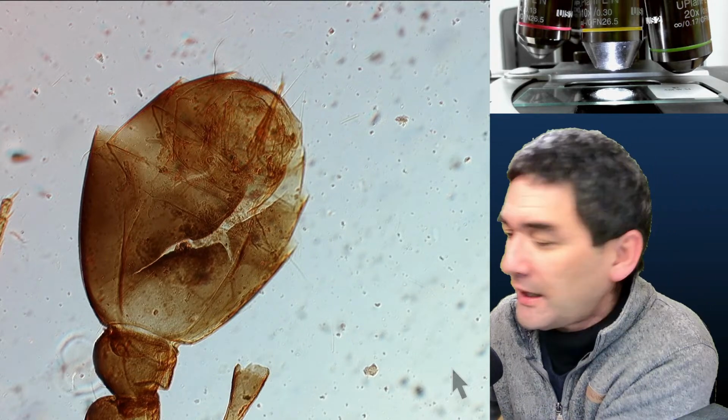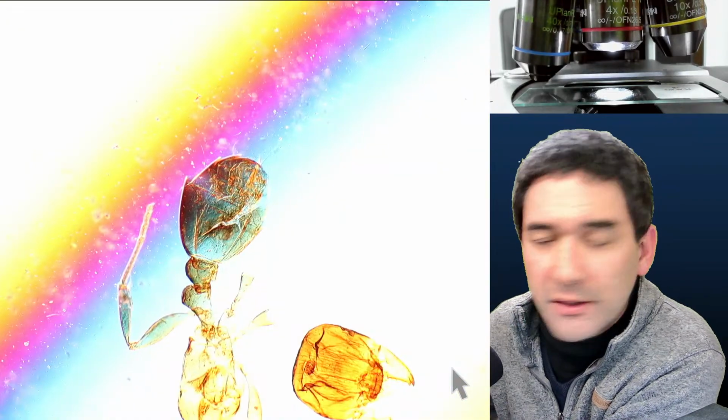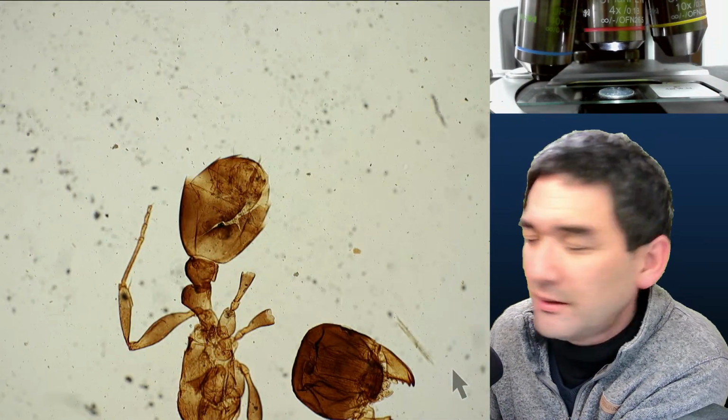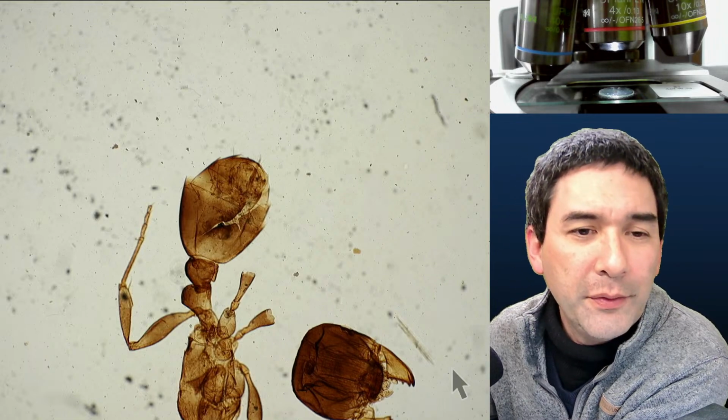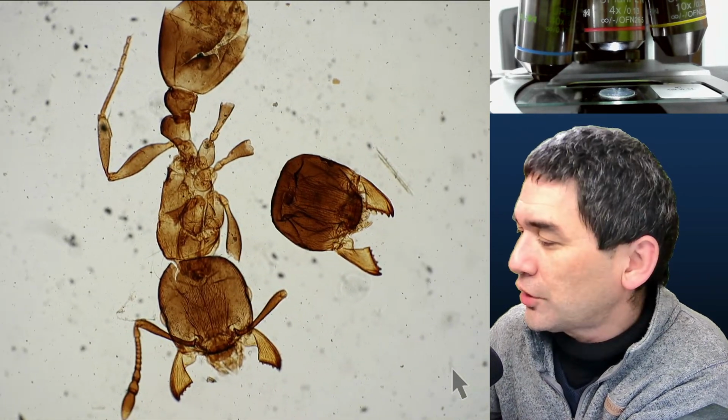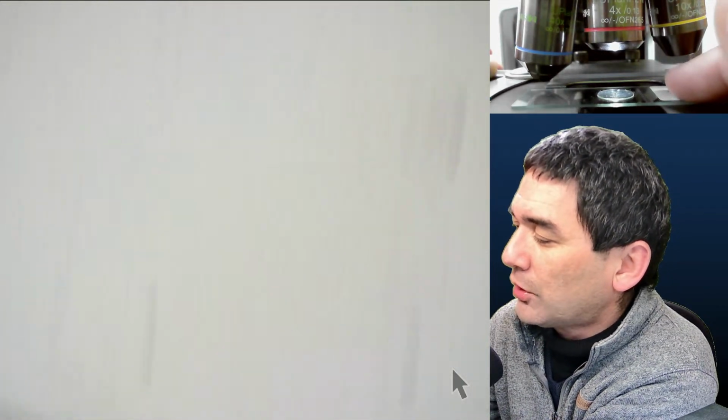And this is actually one that I already showed you some time ago. So you know what, I'm just going to stay with bright field. I'm not going to bother about the polarization filter, because if I just stay with bright field, that's actually the way that you're also going to see it in your microscope.